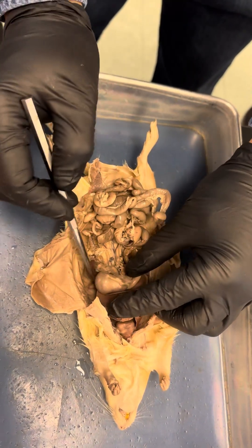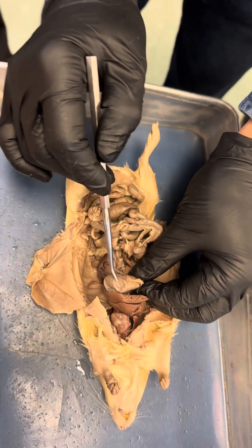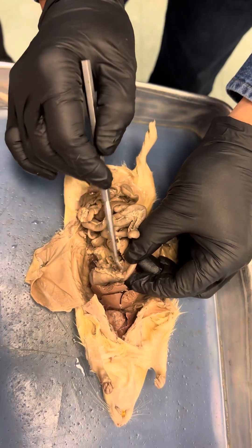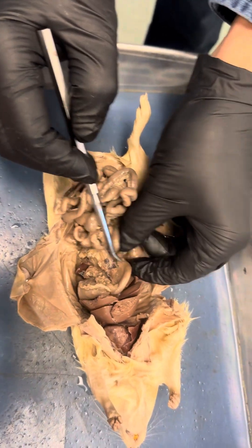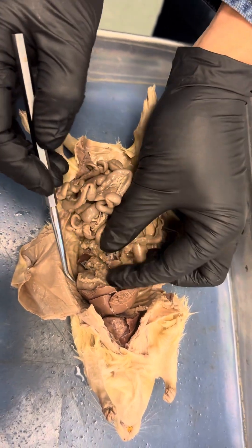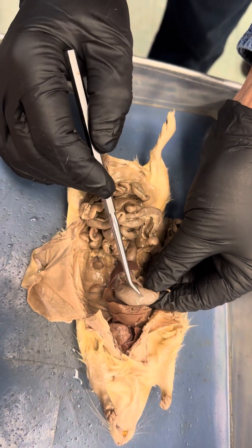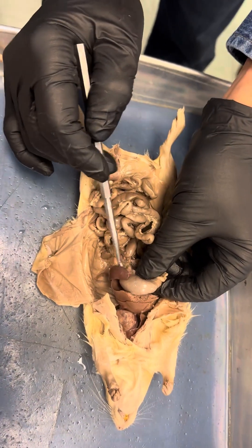Another structure here, the huge structure — this structure is called the stomach. And you can see here, this structure is connected to the duodenum. See, this is the C-shaped duodenum attached to the stomach. This one has a lot of food inside the stomach. This is the duodenum.